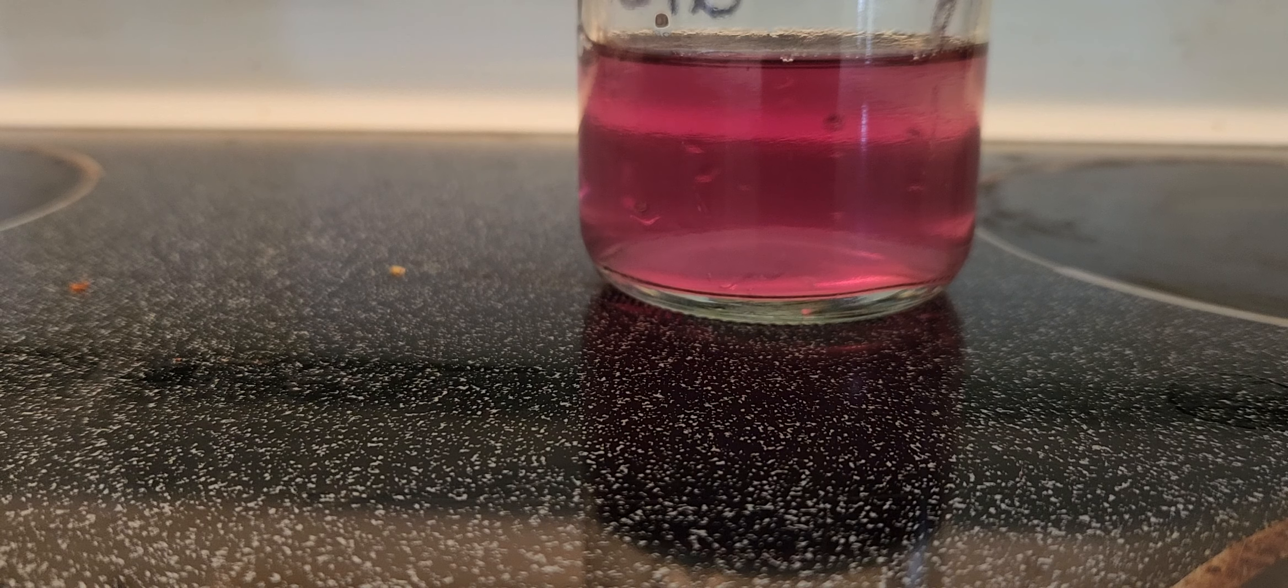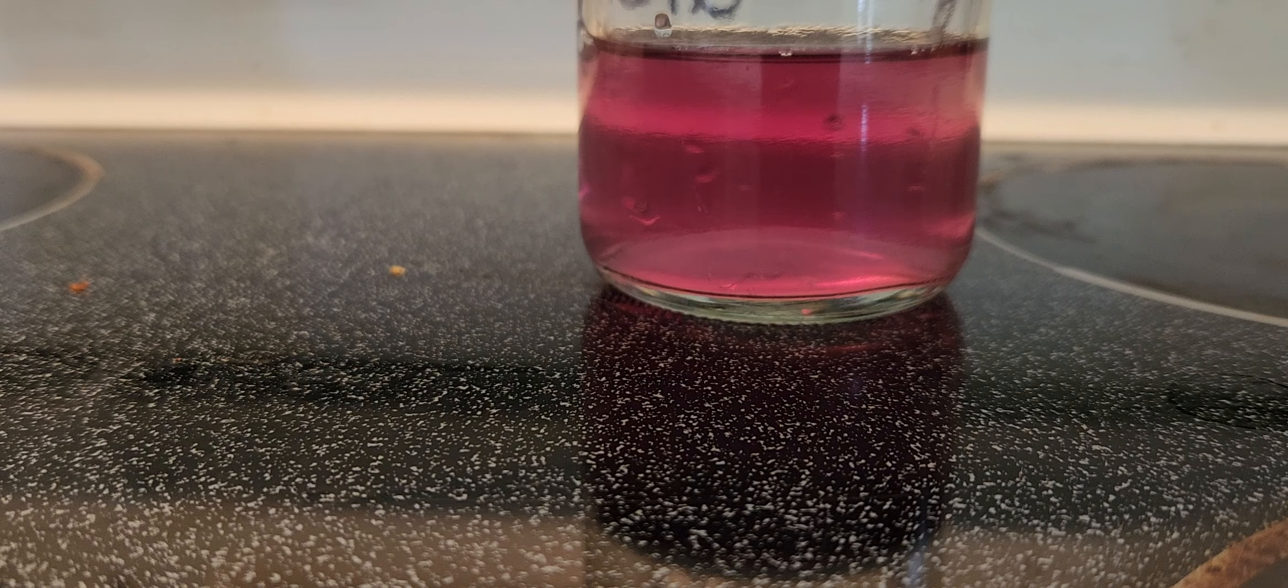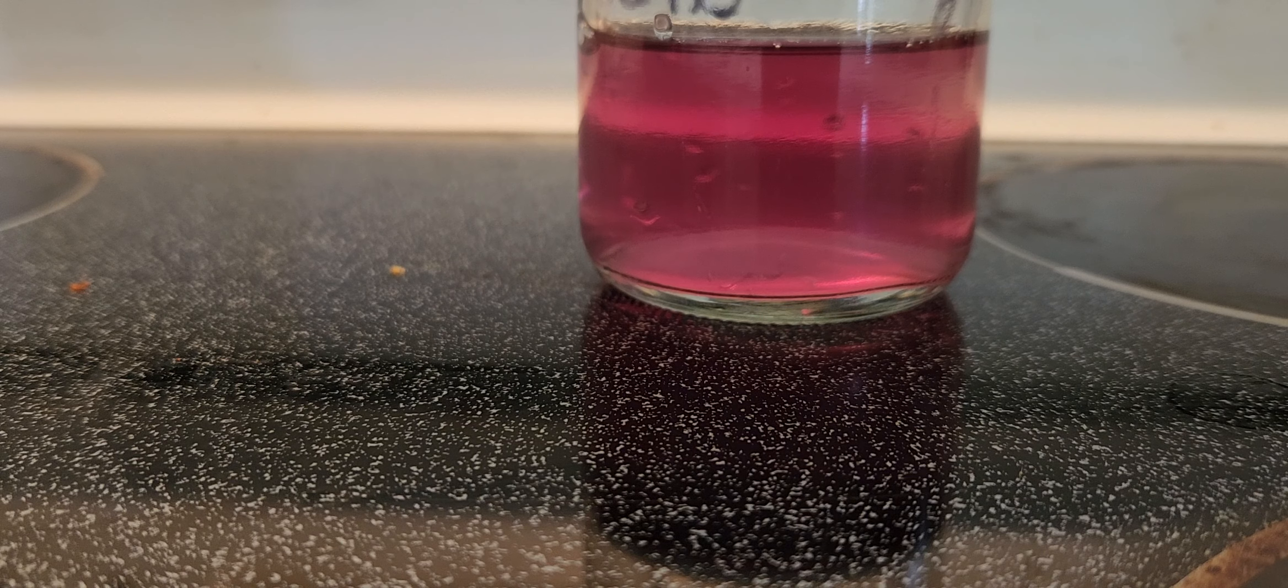But I don't mind it a little bit acidic. The pH is only 4. It's not that harmful.